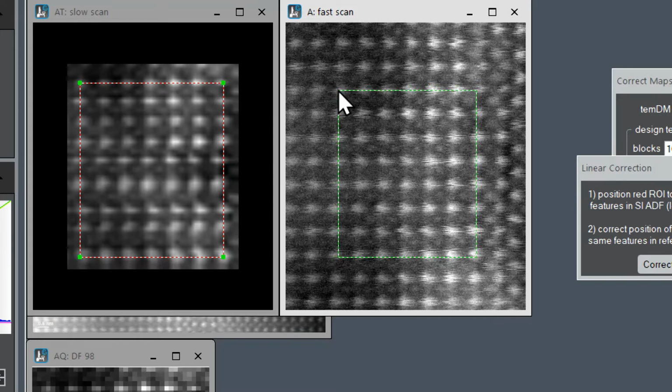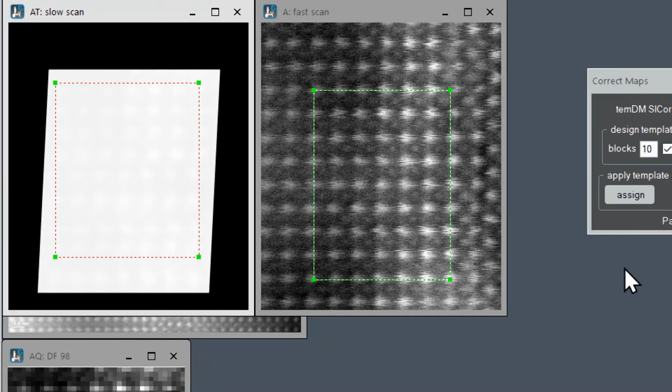Let's move the left upper corner. The right lower corner is more or less okay. But we have to ensure that both rectangles now cover exactly the same areas. For that, probably we need to count atoms: horizontally 2, 4, 6, vertically 2, 4, 6, 8, and the same in the right image: 2, 4, 6, 2, 4, 6, 8. Aha, this corner is not at the right position. It should be there. Now we can press correct.